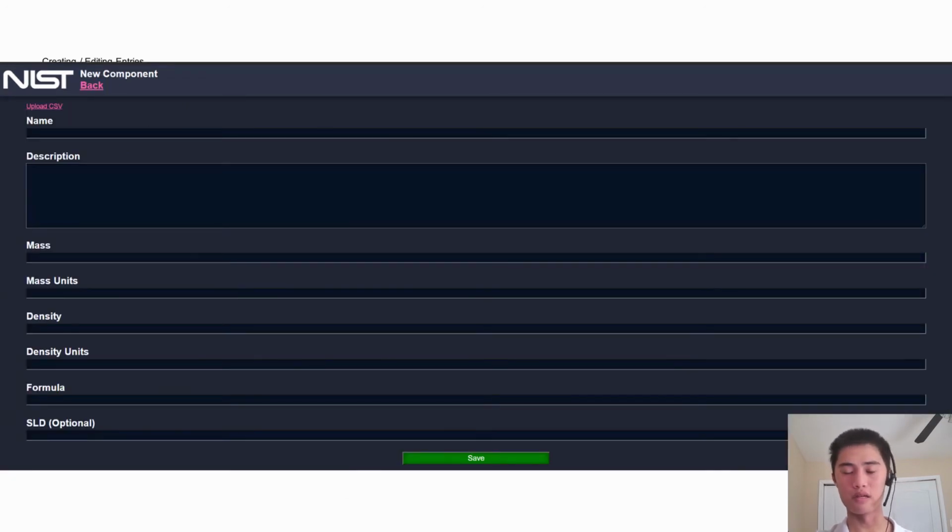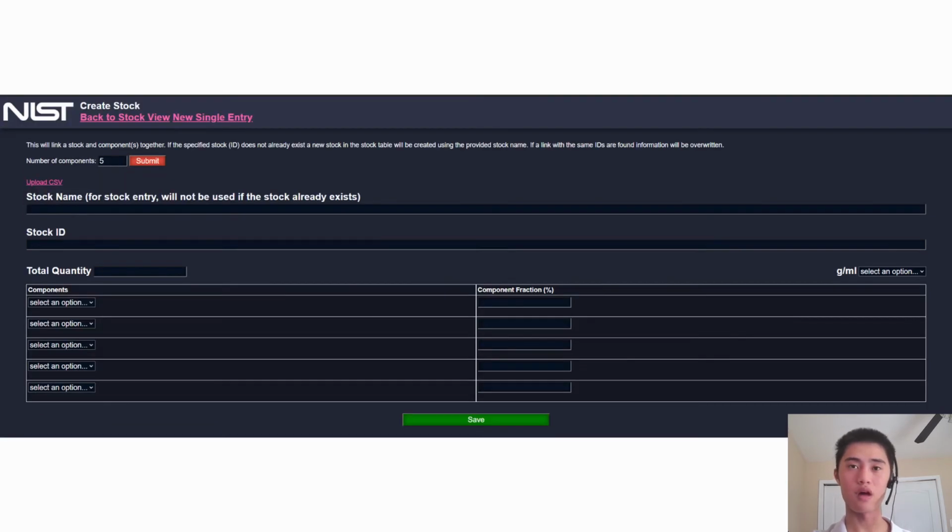Creating and editing entries is a page where you're given forms to fill in for the cells of whatever table you're making an entry in. Depending on what you're creating, these consist of free text and drop-down menus. For the stock and sample tables, you also have an alternative creation option in addition to the single entry that you just saw. Here, we can specify any number of components or stocks to add, along with the percentage of the total quantity, which is either in grams or milliliters.